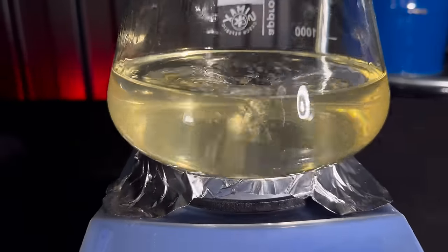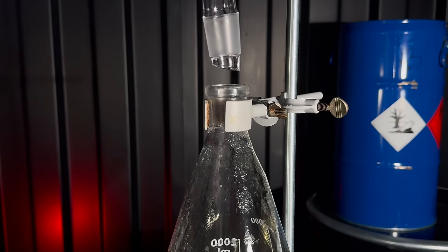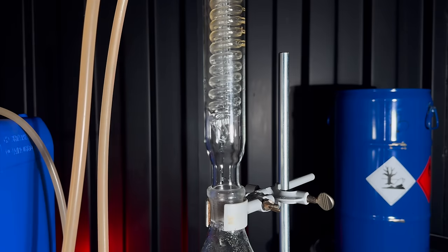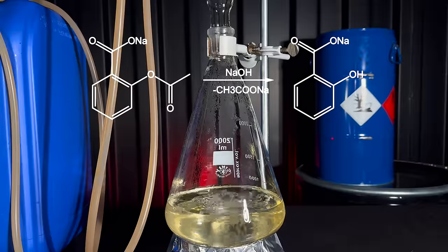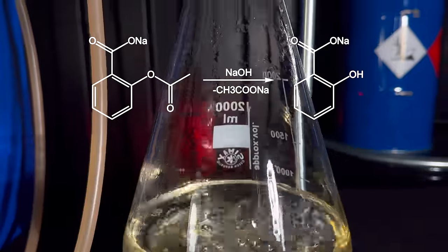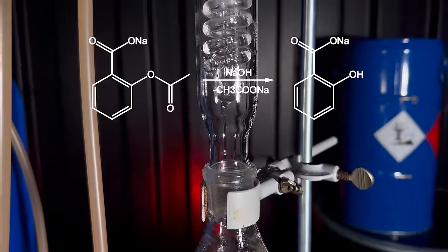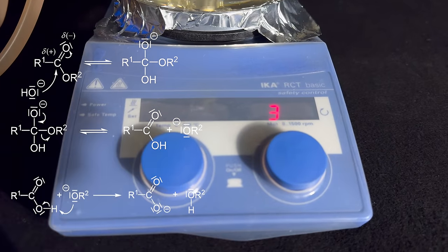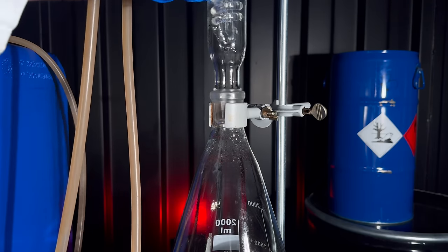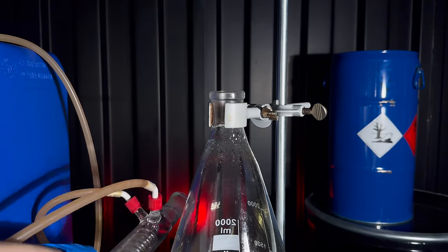I continued by setting up a reflux, because unless you want to wait literal decades for the reaction to take place, you need heat. Under heating, sodium acetate is split off and I am left with the sodium salt of salicylic acid. The sodium salt needs to be turned into the free acid.